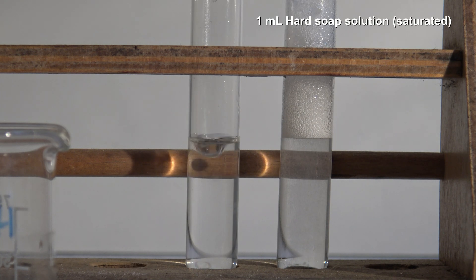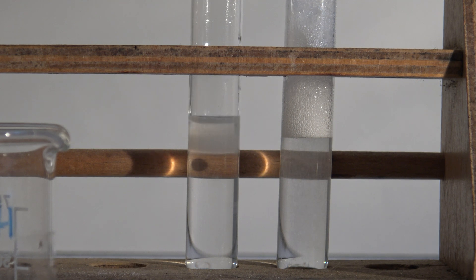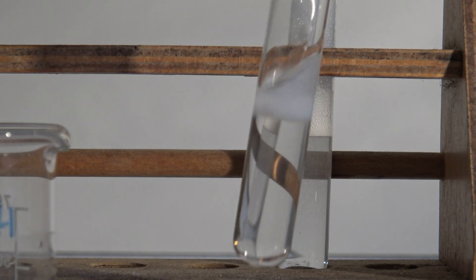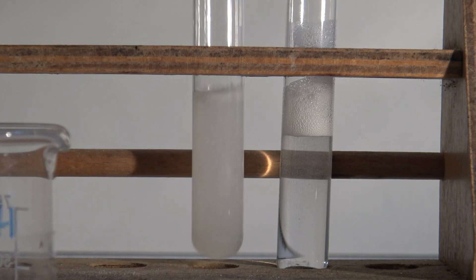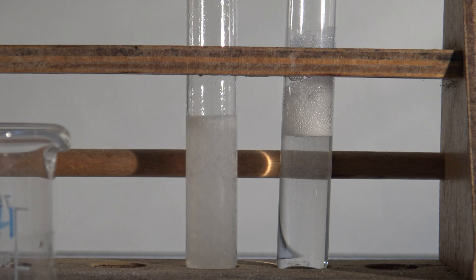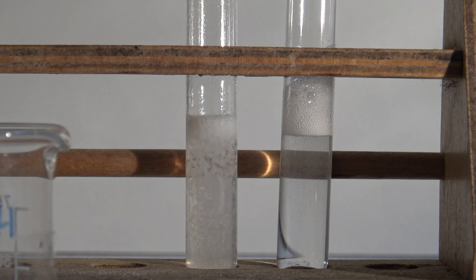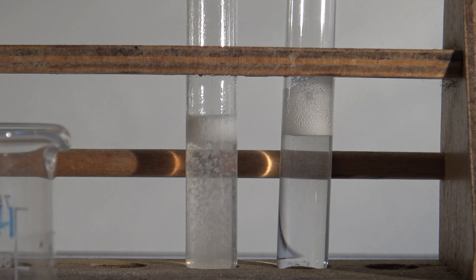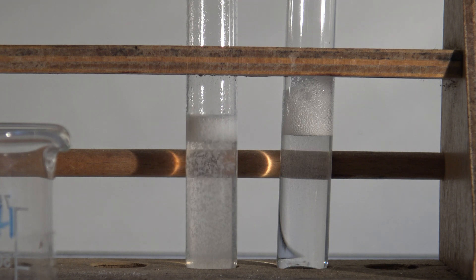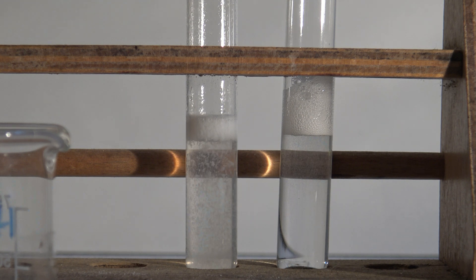As expected, the distilled water solution foams. The experiment is then repeated with the hard water. The solution turns cloudy immediately, and when shaken the whole solution becomes cloudy and does not foam. In addition, an insoluble precipitate is formed. Soaps are usually the potassium or sodium salt of a fatty acid. With the calcium ions, the insoluble calcium salts of the fatty acids are formed — these are also called lime soap.